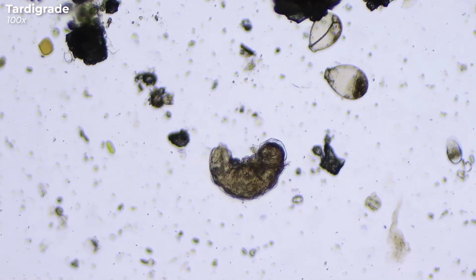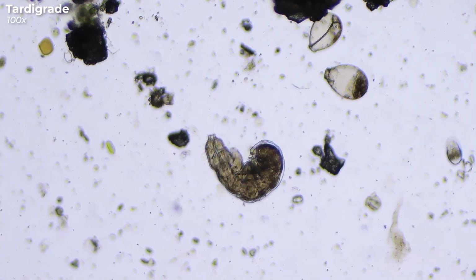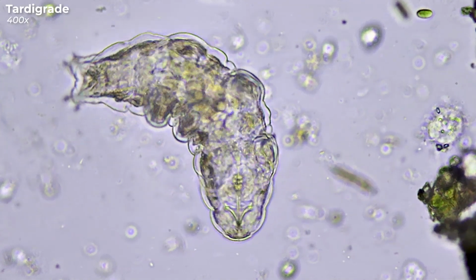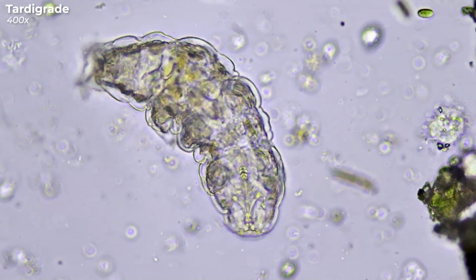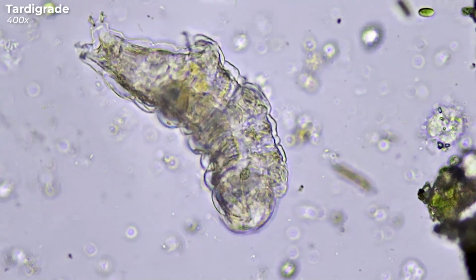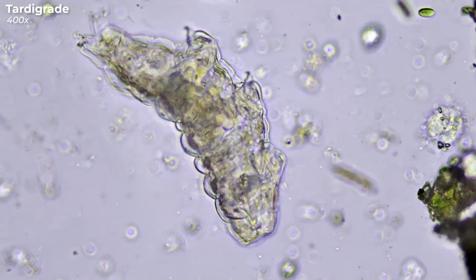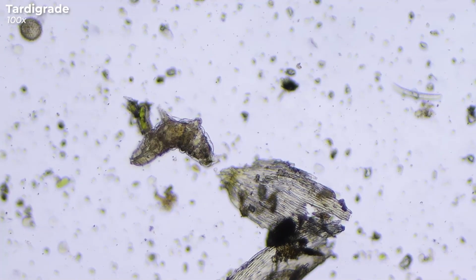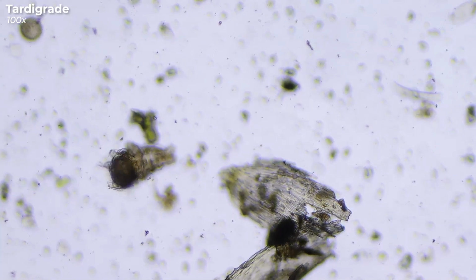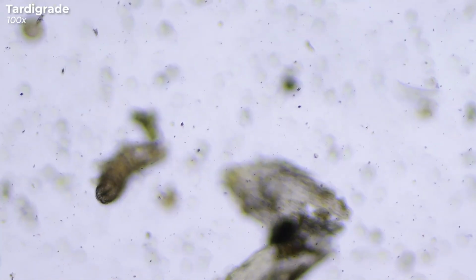These adorable stubby legs are their signature feature, you could say. On these stubby legs are claws that allow them to better cling to a surface or a substrate. But seriously, their clumsy appearance makes them irresistibly cute, and you could watch them for hours, couldn't you?